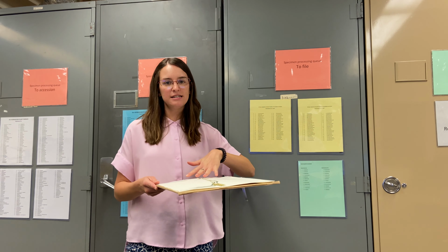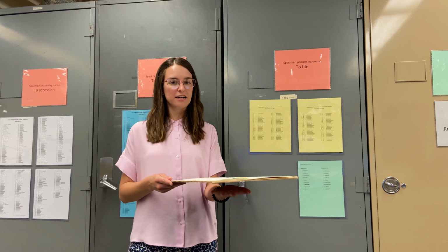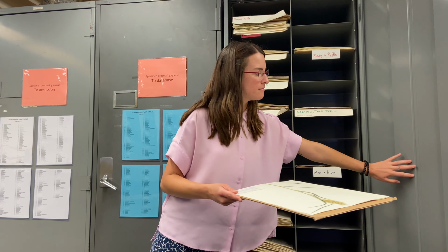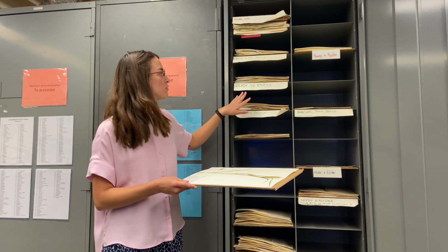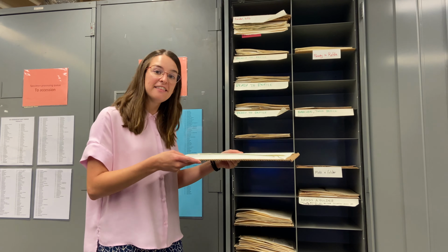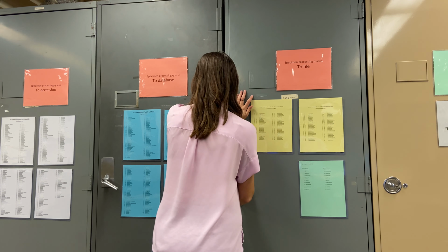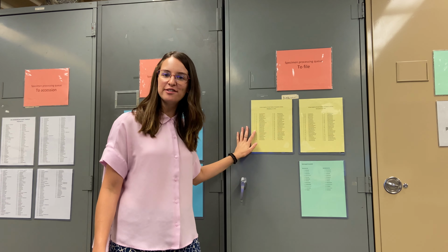So now that these specimens have been databased, they're barcoded, they are ready to be reintercalated back into the collection. So we need to make sure that they go in this cabinet so that they can be refiled. In this cabinet, you'll see that there are cubbies that are labeled ready to refile, and you'll just simply place your specimens in those cubbies, and then they'll be refiled at a later day. With completion of putting your specimen in the to file cabinet, you have successfully databased specimens.